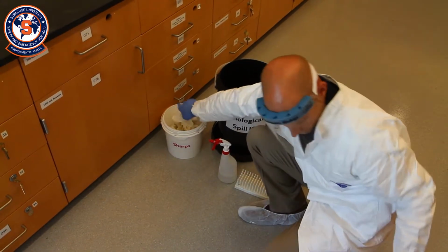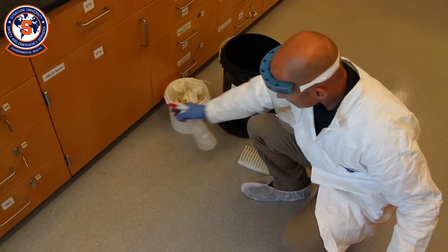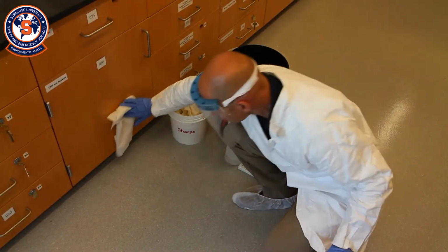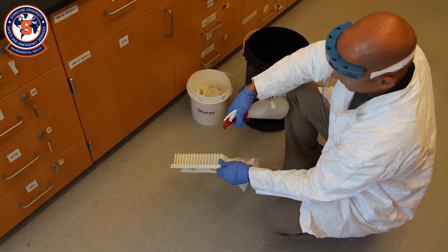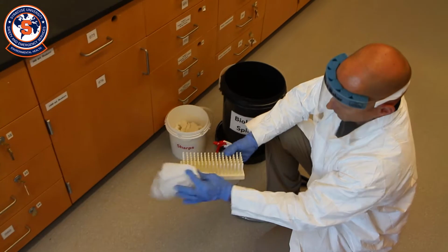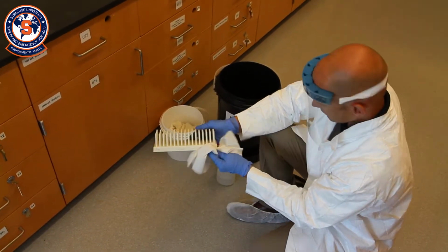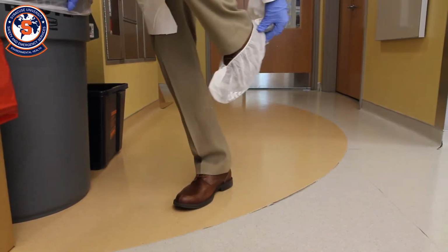After all of the visible contamination has been cleaned up, spray the area again with disinfectant. Allow for the appropriate contact time and re-wipe the area. Dispose of the cleanup materials in a biohazardous waste container and decontaminate any reusable cleanup equipment. After the cleanup is complete, remove your personal protective equipment.